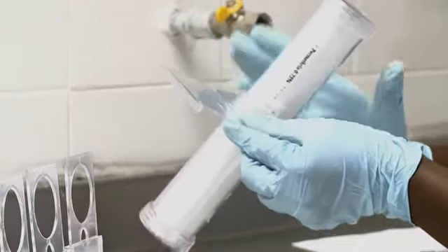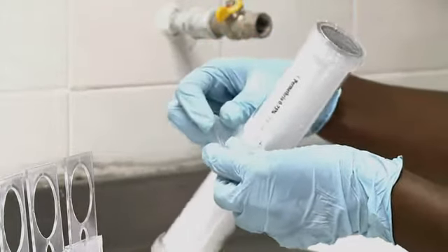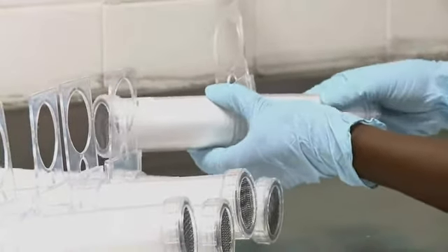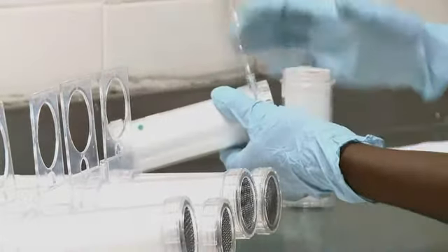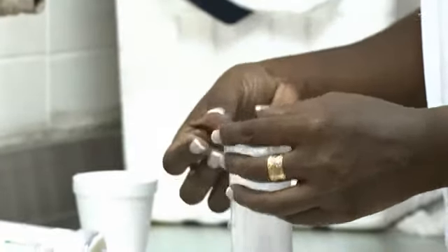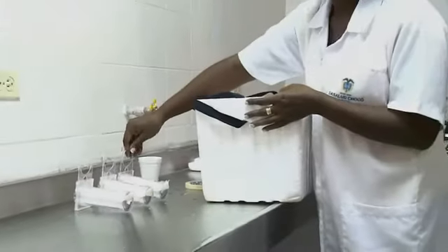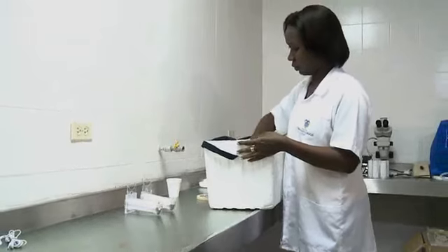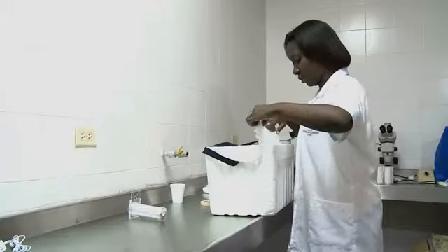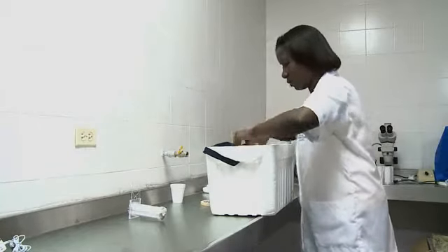Once the exposure time is finished, transfer the mosquitoes back to the resting tube for 24 hours. Separate the exposure tube from the resting tube. Attach a piece of cotton wool soaked in a 10% sugar solution to each resting tube. Under field conditions, the tubes with the mosquitoes should be covered with moist towels and kept for 24 hours in insulated coolers. Make sure to use different coolers to store the resting tubes for the controls and the resting tubes for the exposed mosquitoes.